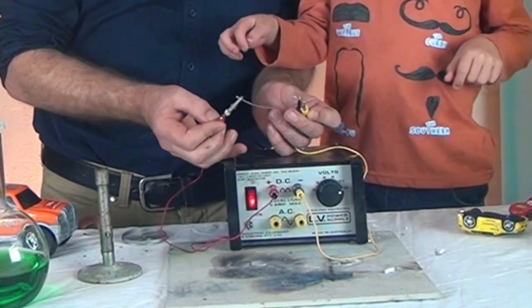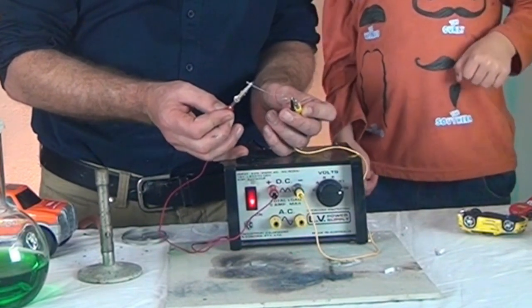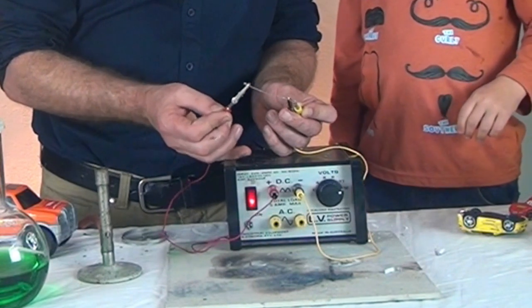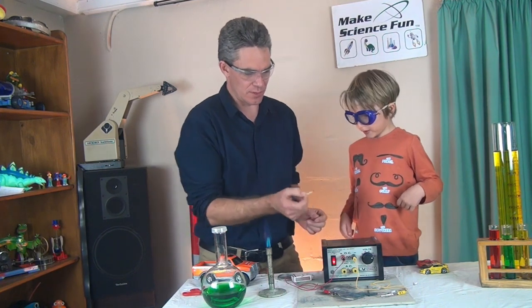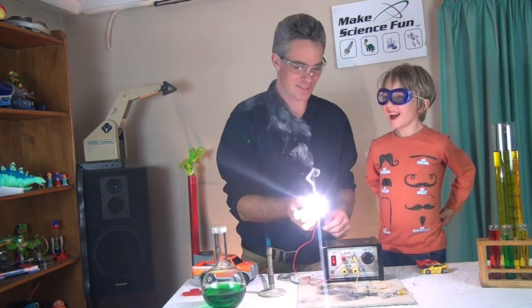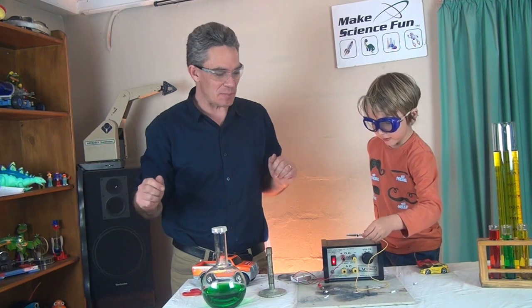Can I hold it? It's a bit dangerous, Sam. You got your goggles on? It's making fire noise. Firework noise. Whoa! Firework. Good job, Sam. Here we go. Oh, look at that. Smoking.